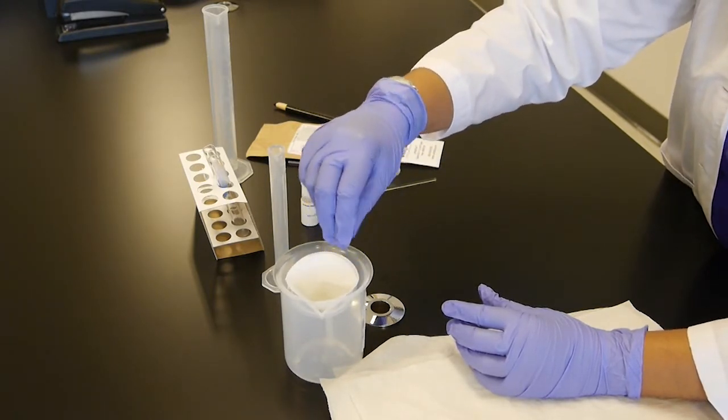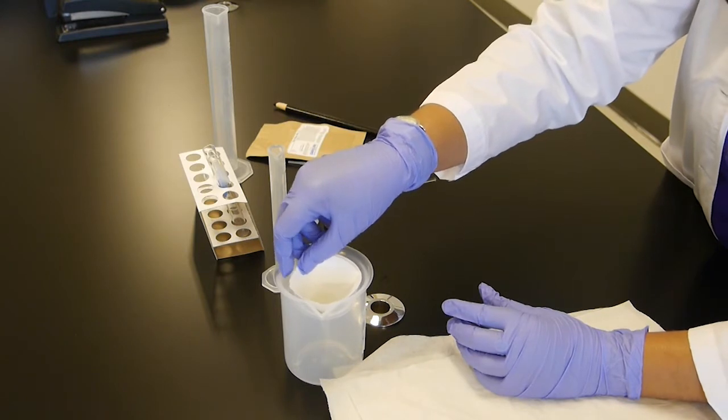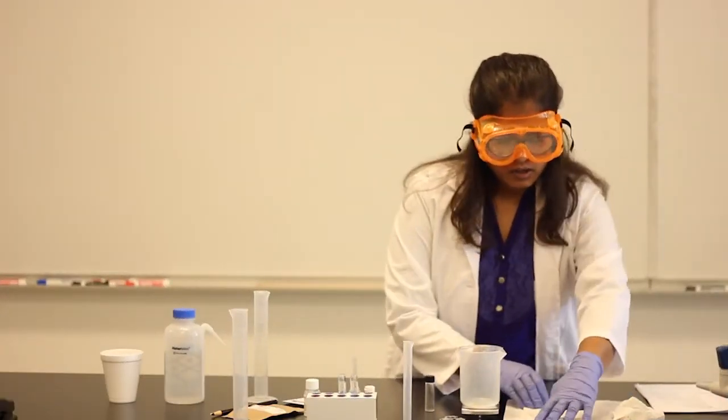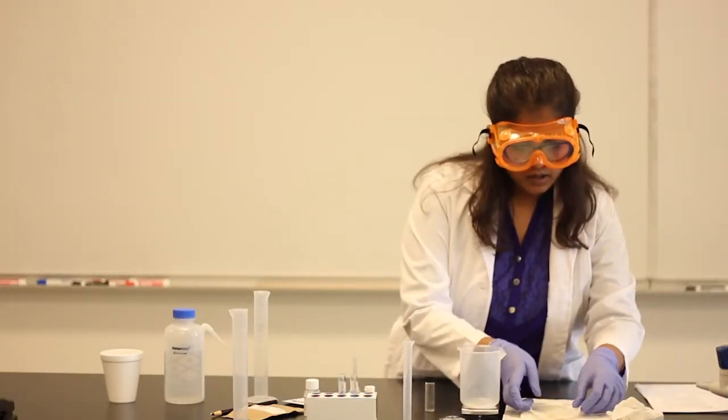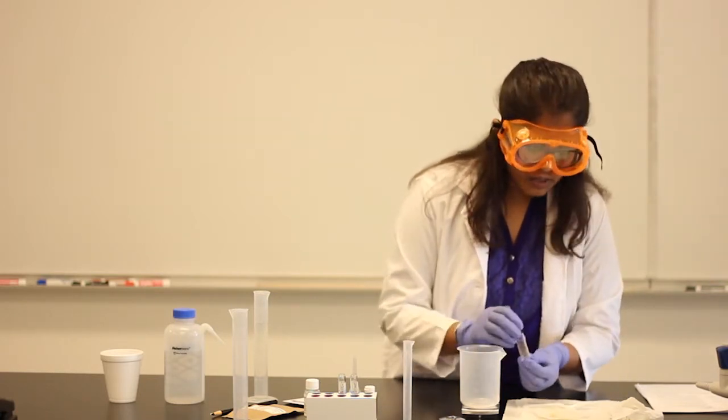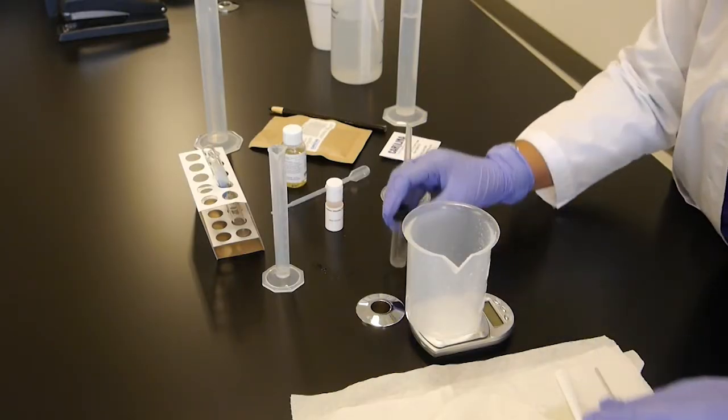And make sure to let it dry. You might keep it to rest overnight. It might take some time. So while you keep your soap, whatever you made, make sure when you filter it out, to empty out all of the content in the vial.